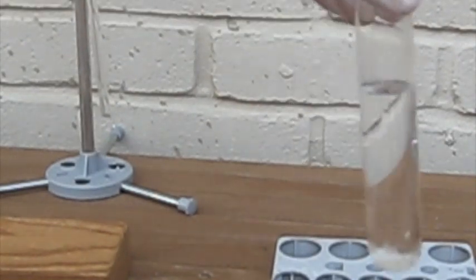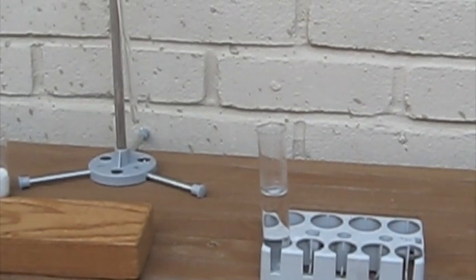Here's the final product. Using more chemical in the test tube, which produces hydrogen chloride, or using less water will produce more concentrated hydrochloric acid.